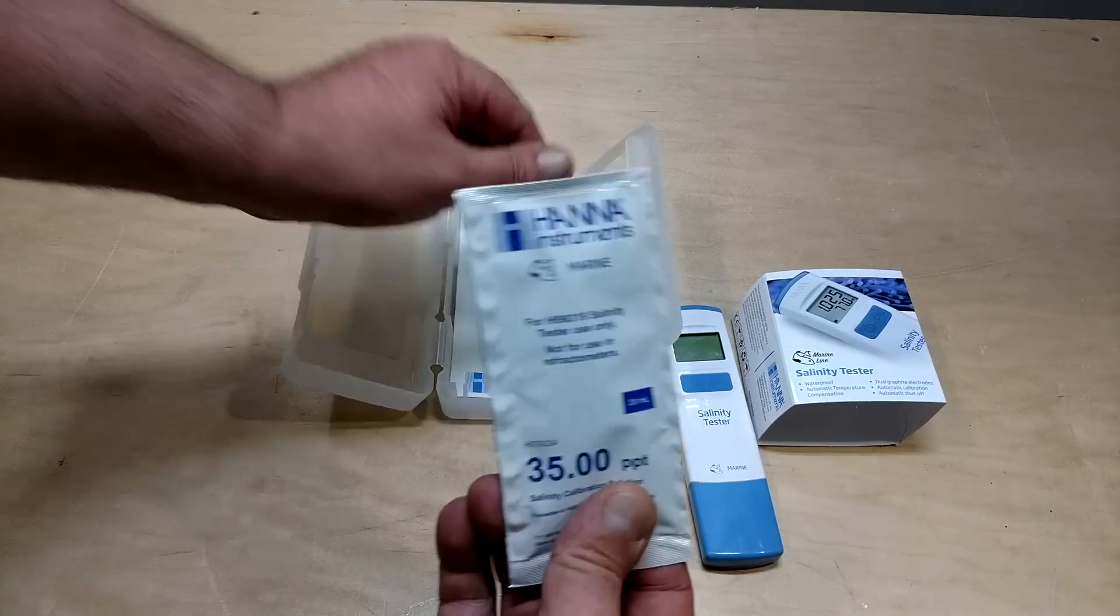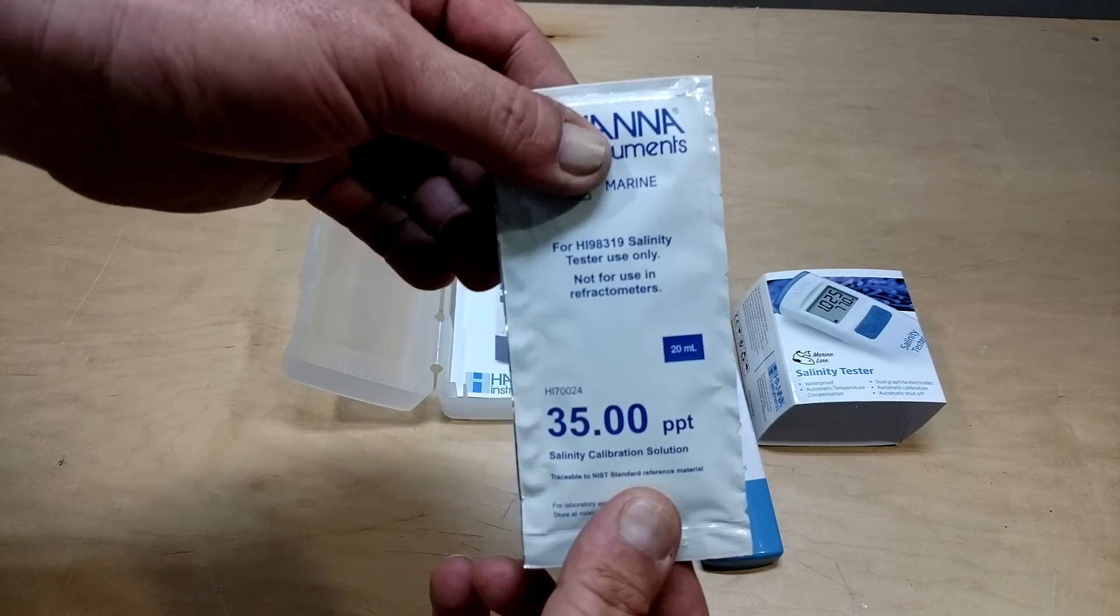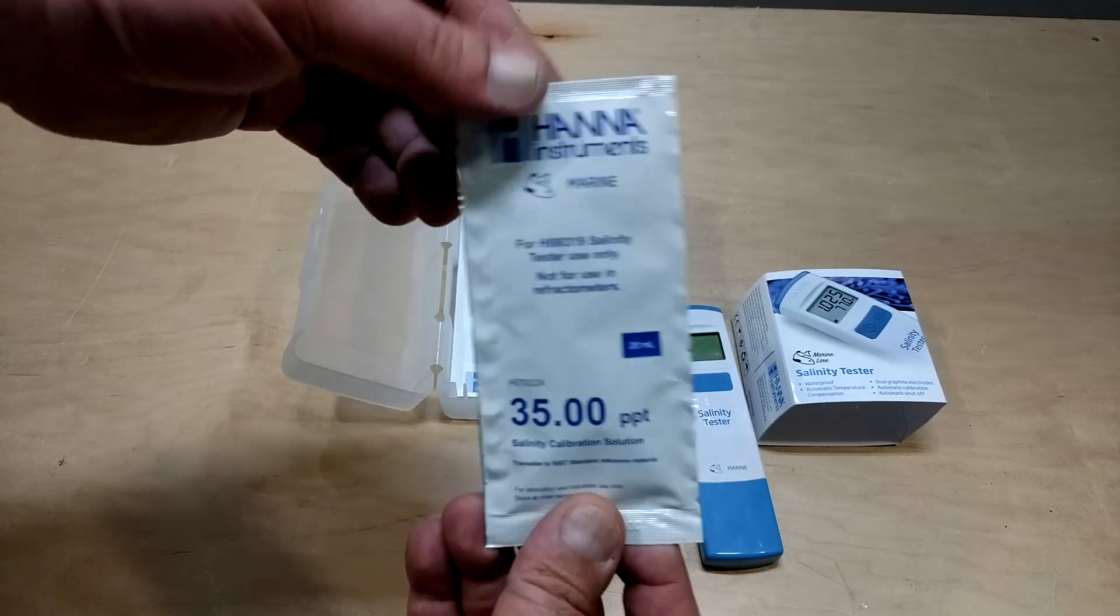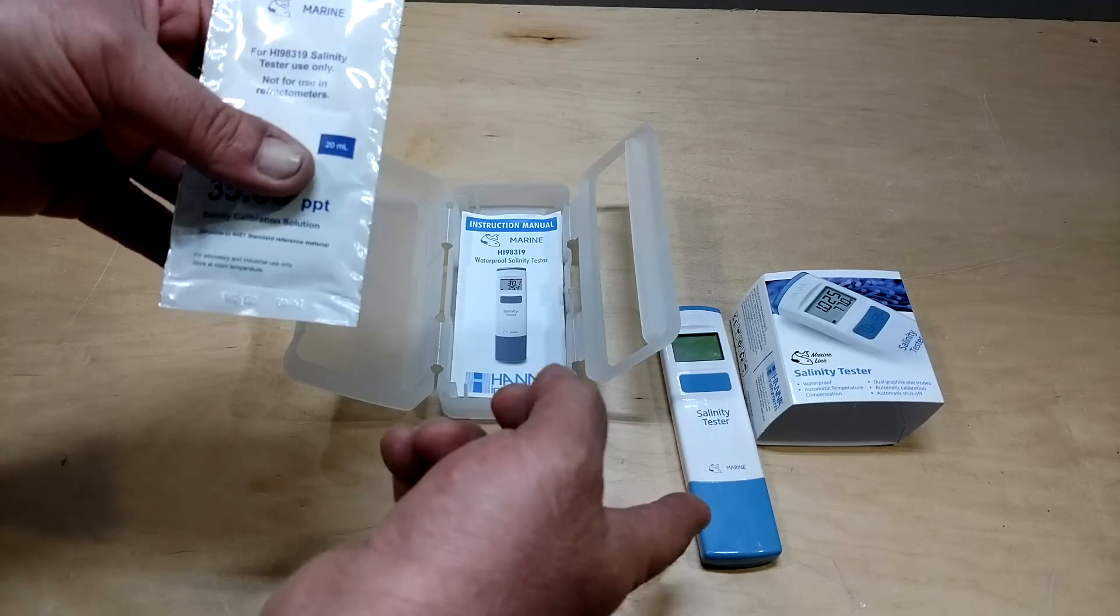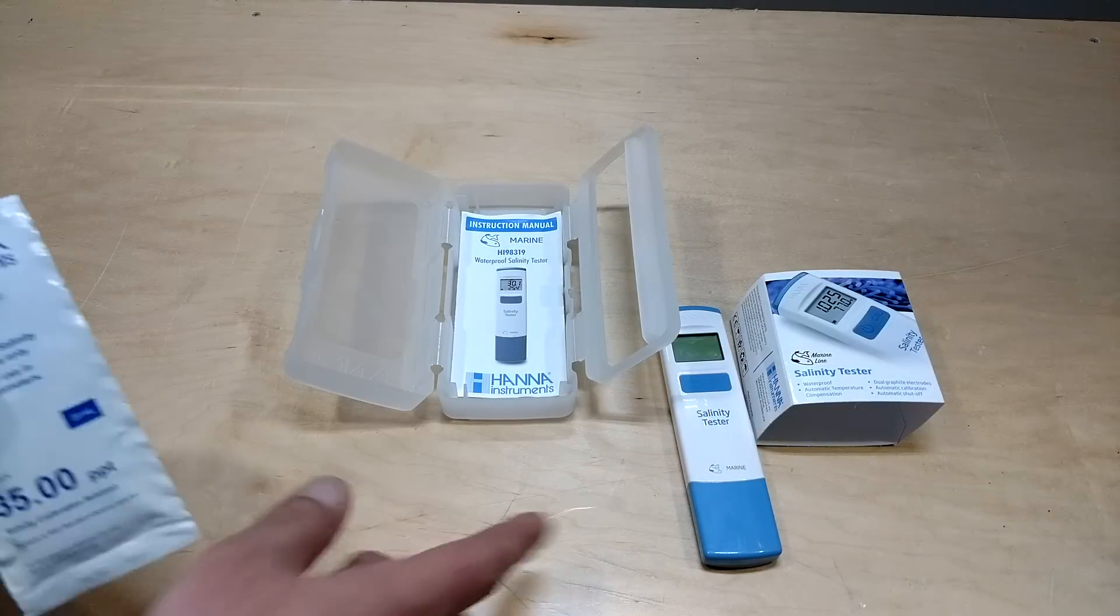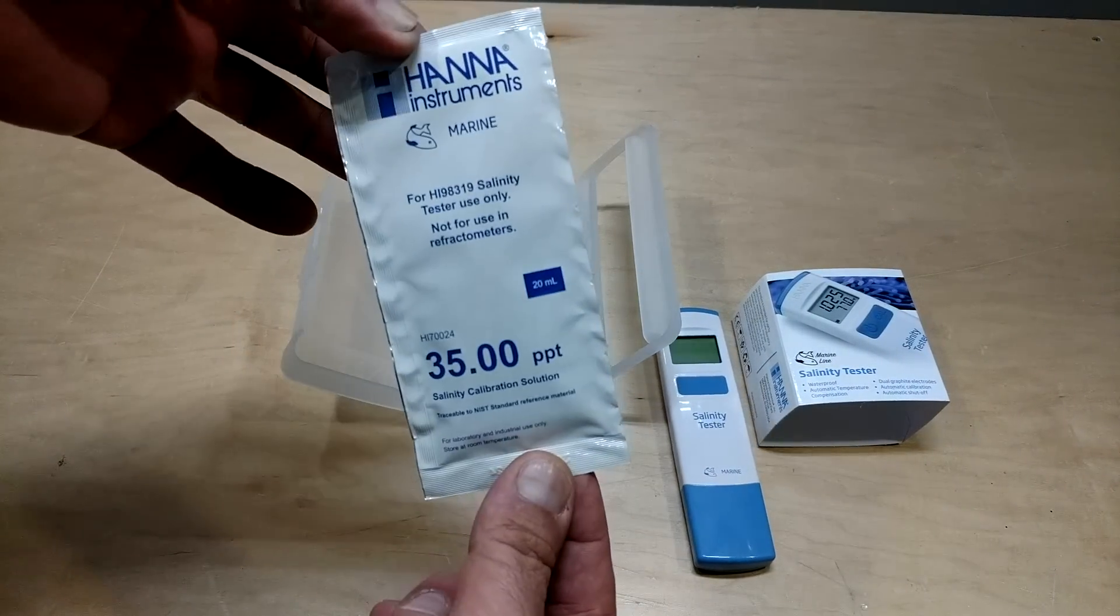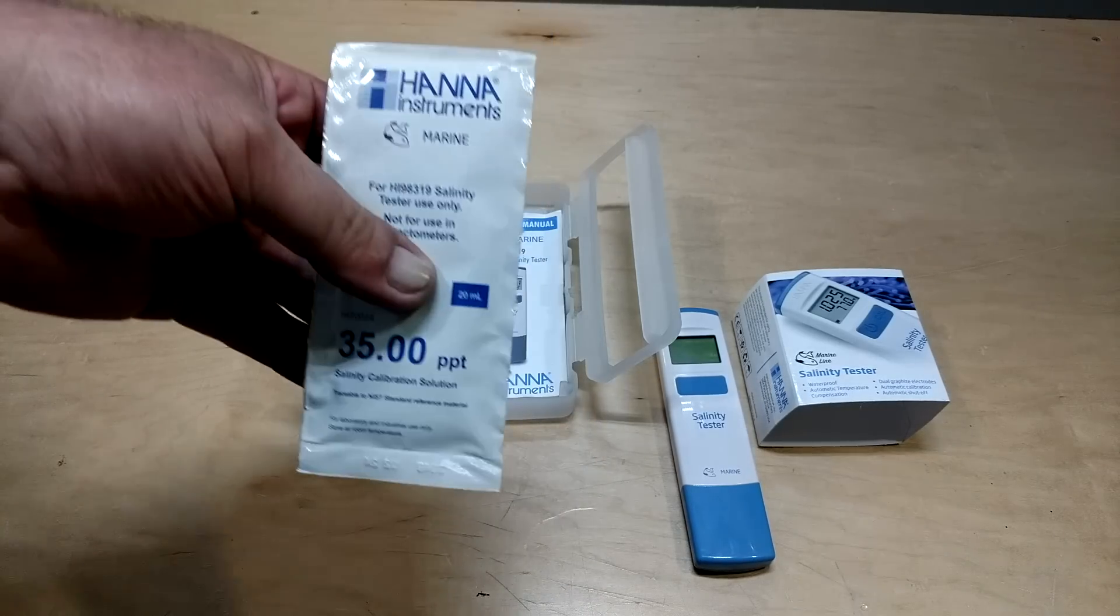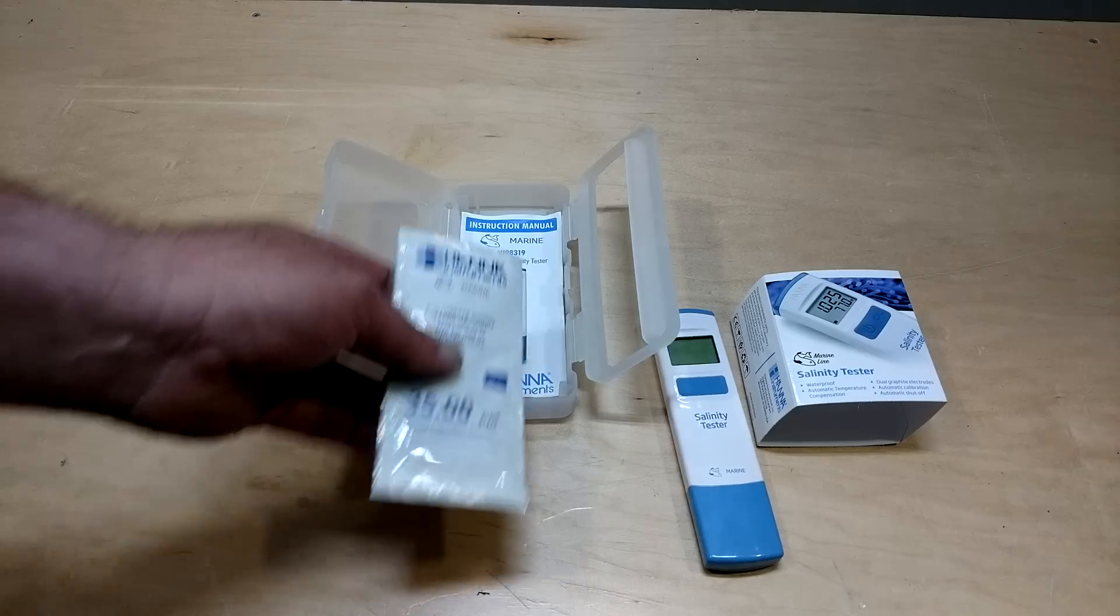So it does come with the solution to calibrate it. It comes with four solutions. I only have one left because I like to test things and I've had this for a little while. So the directions say, I believe, to calibrate it monthly, which is fine. You can get these for like a dollar. So in reality, it only costs you $12 a year to maintain this, which is pretty good.